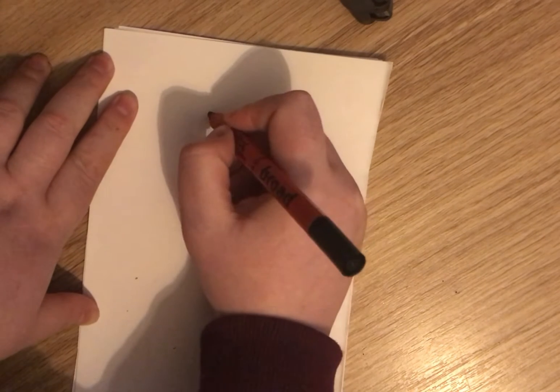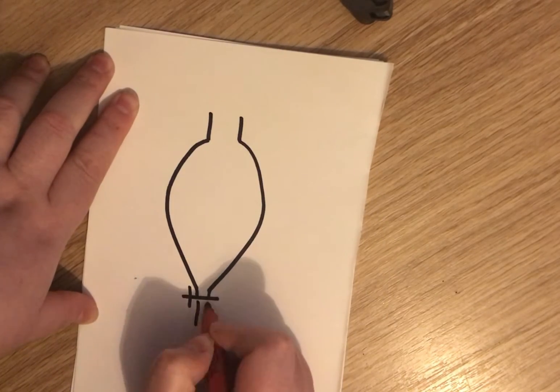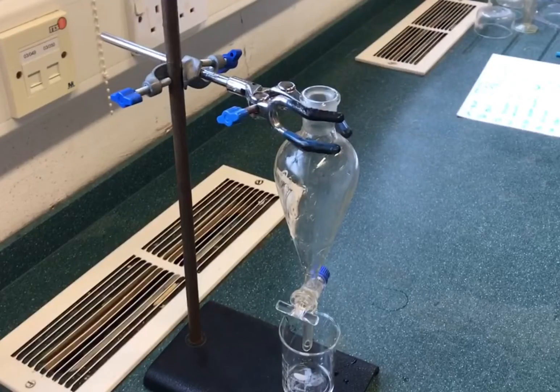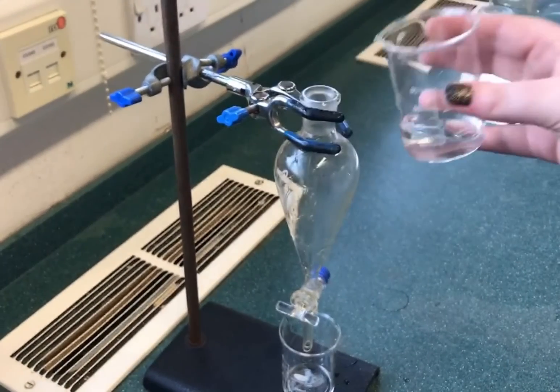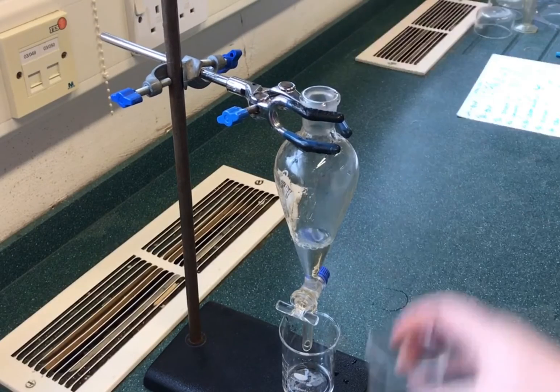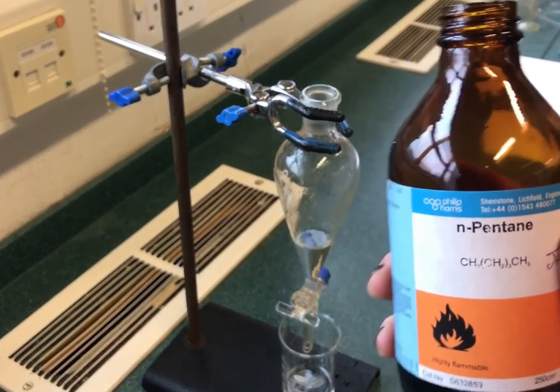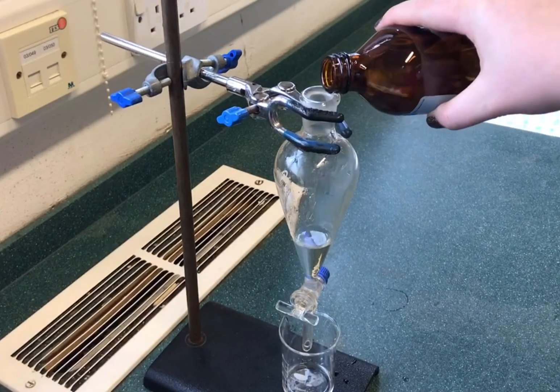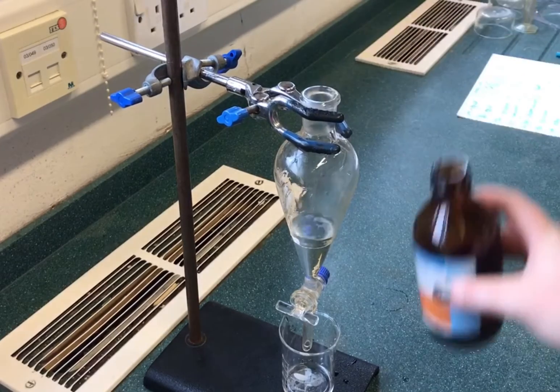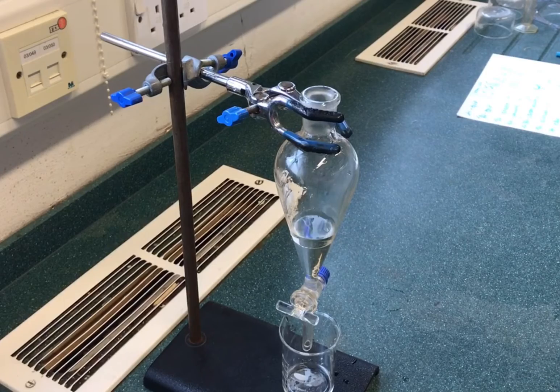Solvent extraction is carried out using a separating funnel. The solution is shaken with a second immiscible solvent. Periodically, the gas that builds up is released by opening the tap. The solute dissolves in both solvents and an equilibrium is set up. The layers are allowed to separate and then run into two separate beakers.